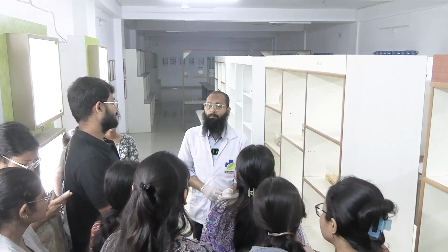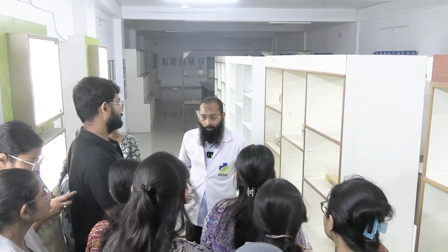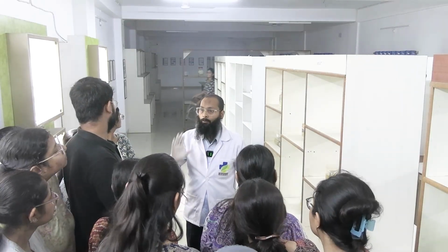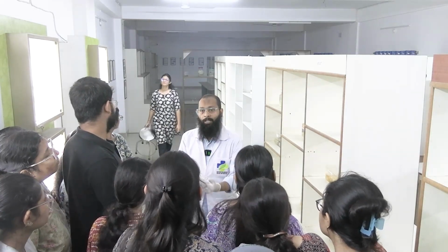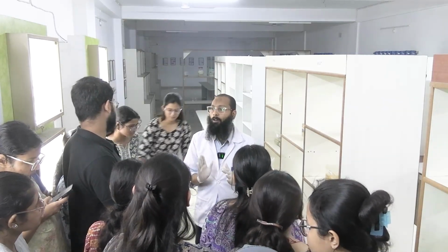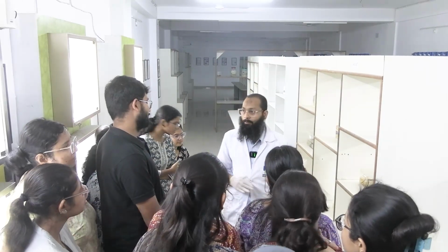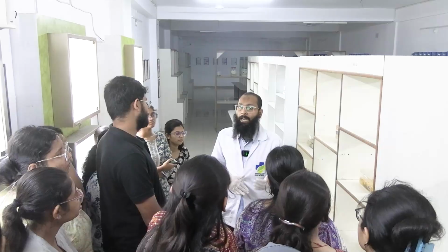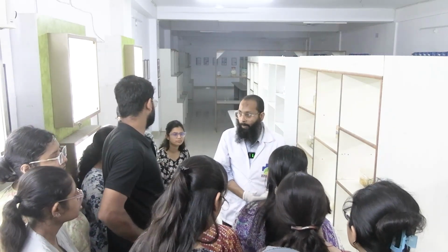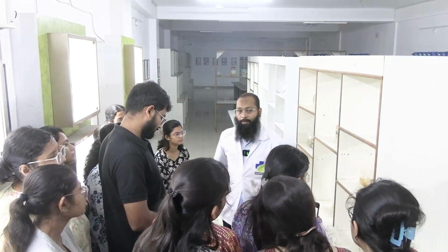40% কি? ফরমালিন না, ফর্মালডিহাইড dissolved in water. Okay, and a saturated solution is made, that is 100% formalin মানেটা কি? Water containing 40% of the formaldehyde, that we call as 100% formalin, and that is diluted. কতটা dilute করা হয়? 10 times, from 100 it is diluted to 10%. Okay, and this is the solution which you can see here, that is used for preservative.